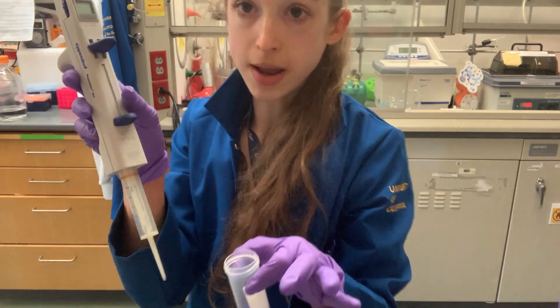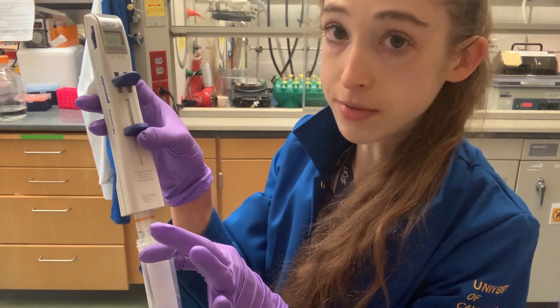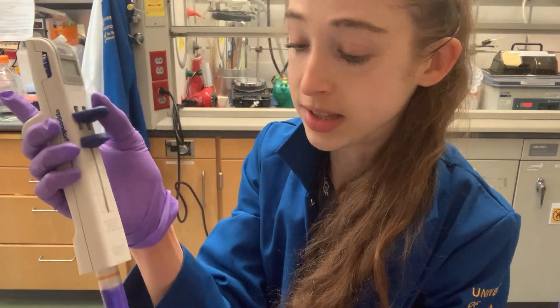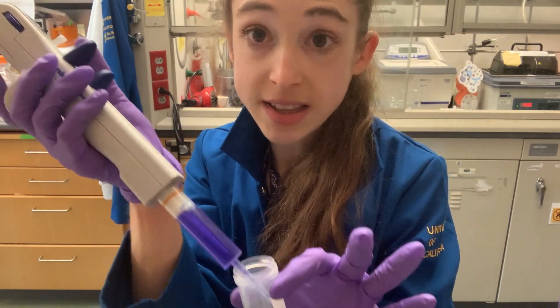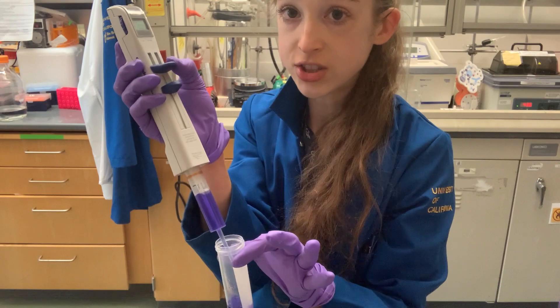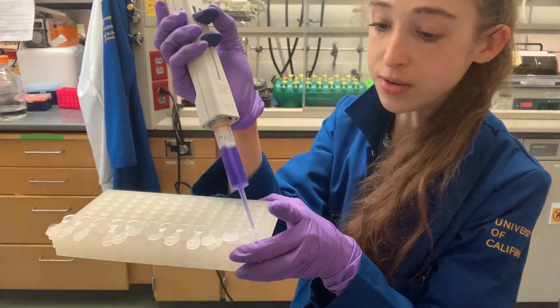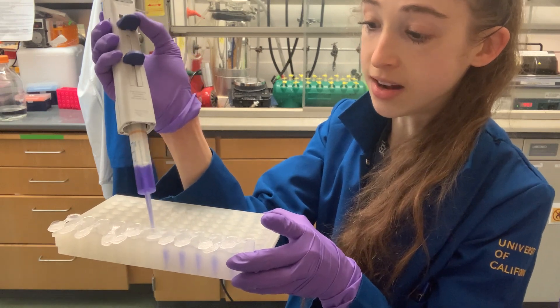To use it, stick the pipette in your sample and pull up on the bottom lever — it moves at the speed of your thumb. To dispense steps, push the top lever. After that first push, each subsequent press should deliver the exact step size you set. With 500 µL set, you can see it counting steps. Each press dispenses another 500 µL aliquot into each separate tube.